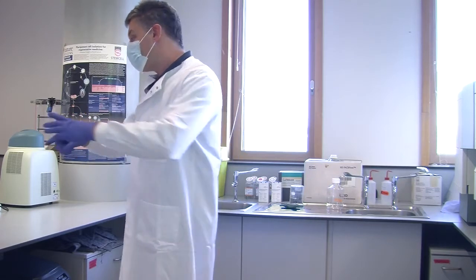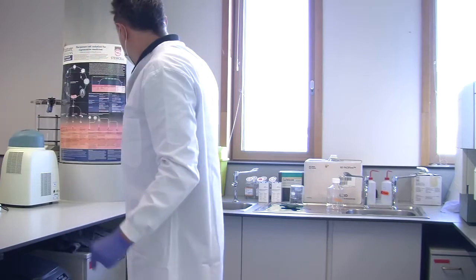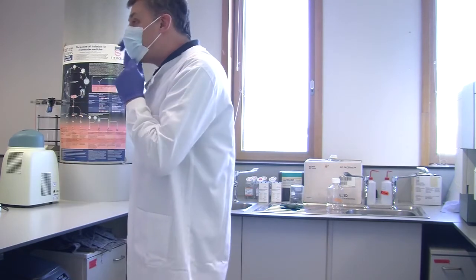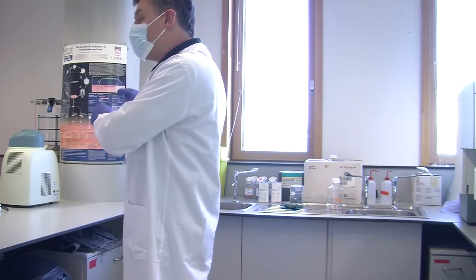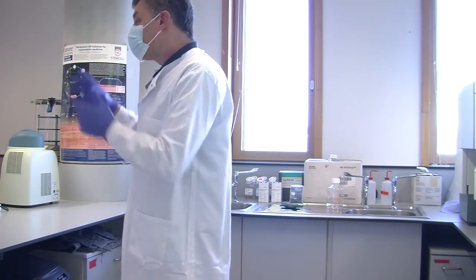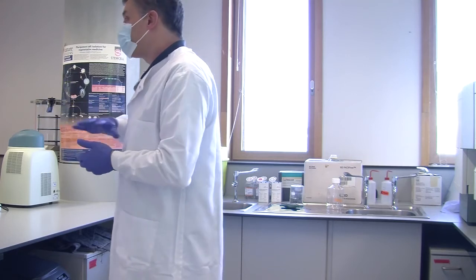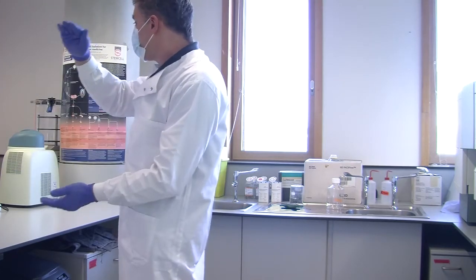In the middle of the room, they have a robot that's as big as this bench, and they load it up with antibodies at this end, they put the tubes of cells on at this end, empty plates in that corner, they program it all and press go, and it pipettes cells, it pipettes antibodies, it has plate centrifuges, so it spins them. So what you're doing now, it does that on 96 well plates all day. And the robot just runs it. And it outputs a rack of plates at the end.